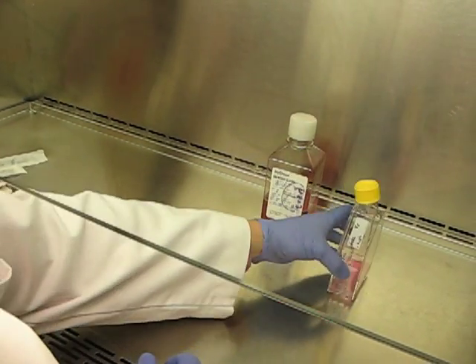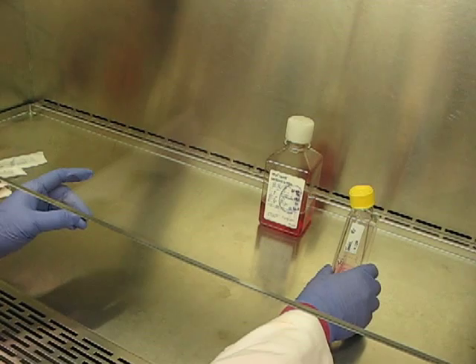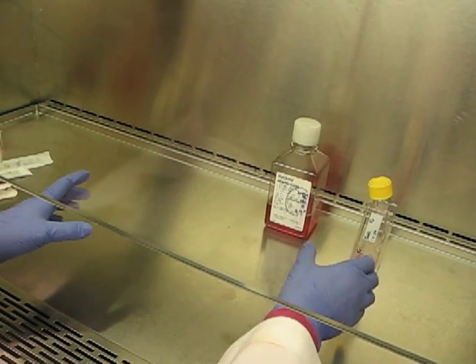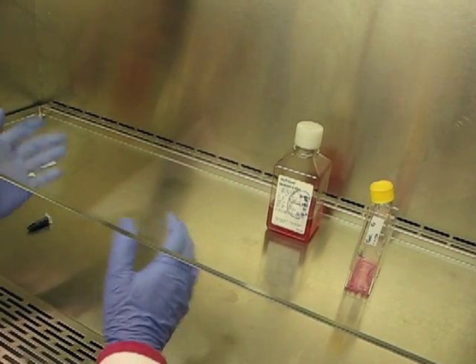I move my stuff backwards. Remember, this is your flask with your cells in it, so you want to make sure you hold on to it until you reseed onto new flasks.